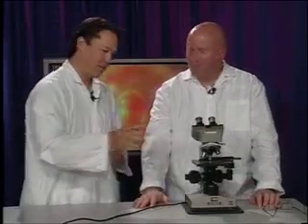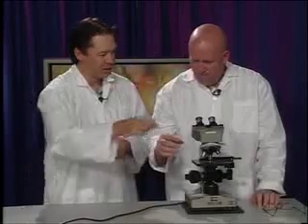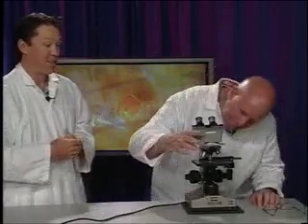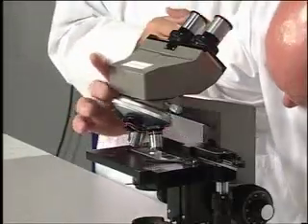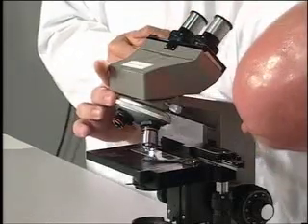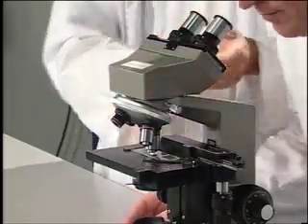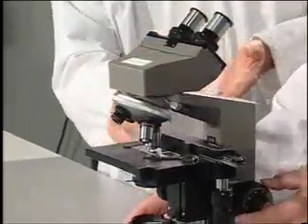You are. Turn the revolving nose piece, and this time you're really going to want to be careful when you click it, just to see how close it gets. If at any time it looks like it's going to touch, don't force it. I think I'm okay. Snap. Now you can really see why you don't want to use that coarse focus knob, because if you were to accidentally turn it the wrong way, you could shatter both the lens and the slide.